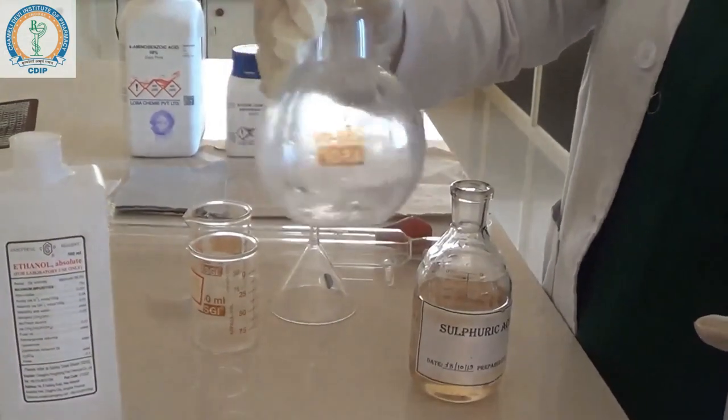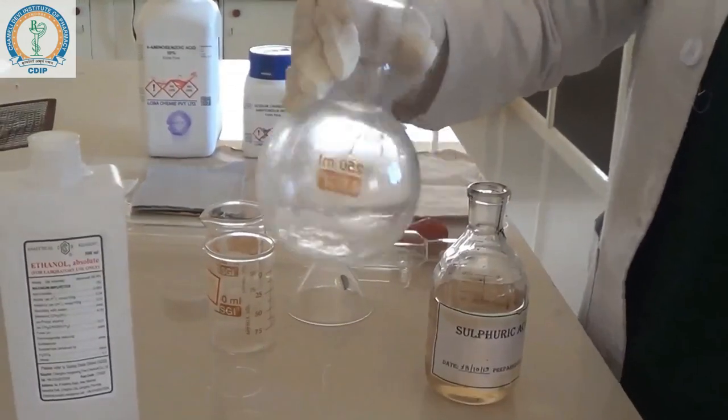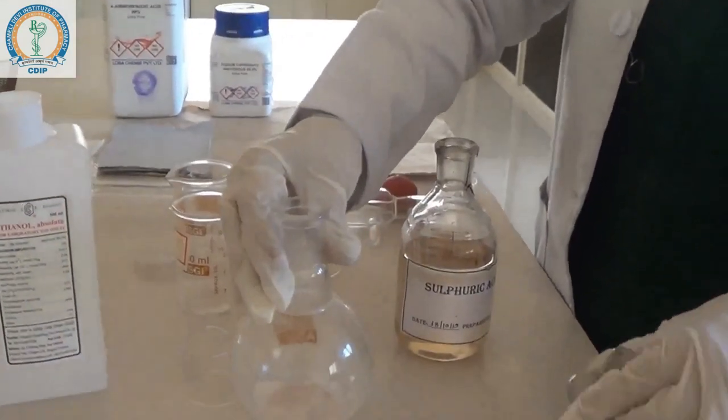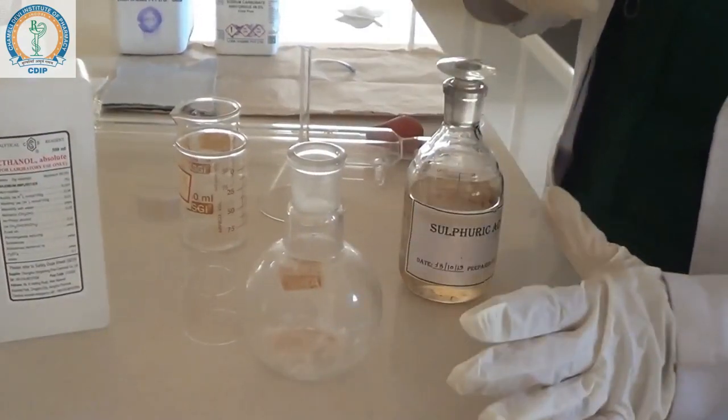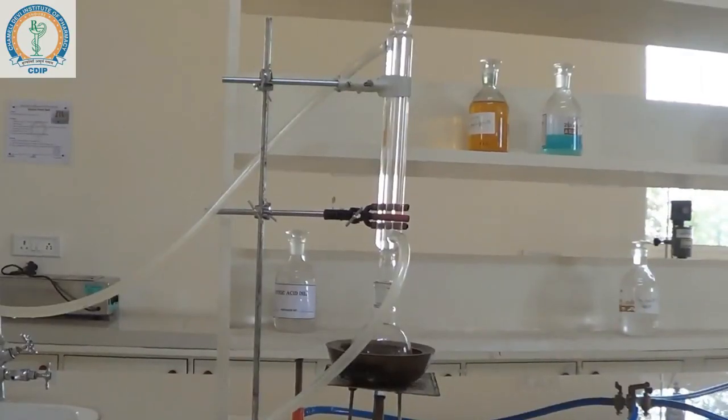Thereafter, we have to prepare an assembly with condenser and water bath. Reflux the reaction mixture for two hours on a water bath till it becomes a clear solution.